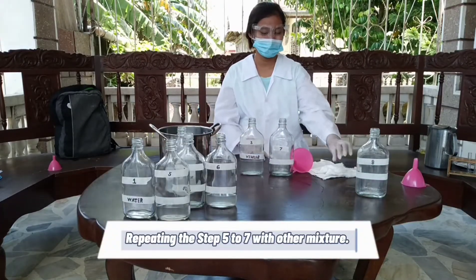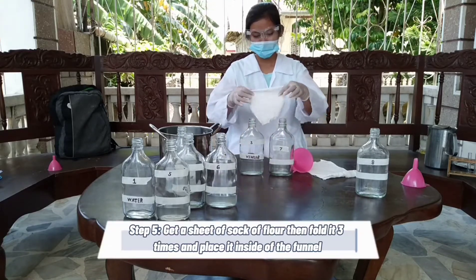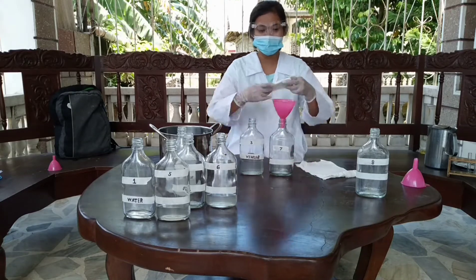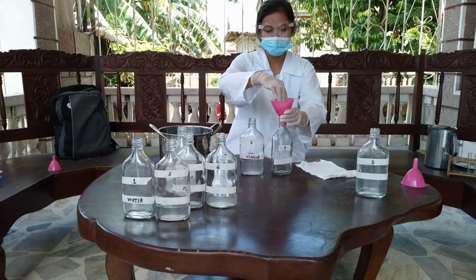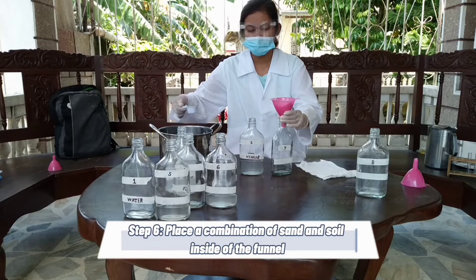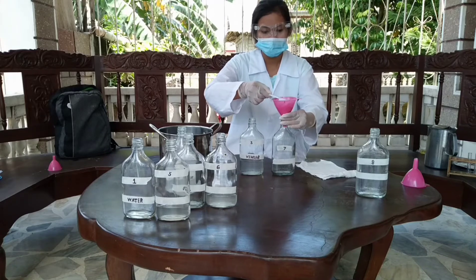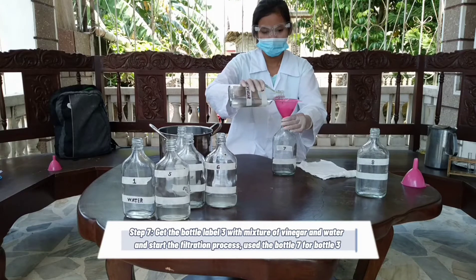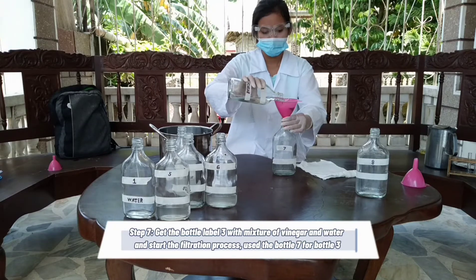Repeating steps five to seven with the next mixture. Step five: get a sheet of sack of flour, fold it three times, and place it inside the funnel. Step six: place a combination of sand and soil inside the funnel. Step seven: get bottle labeled three with the mixture of vinegar and water and start the filtration process. Use bottle seven for bottle three.